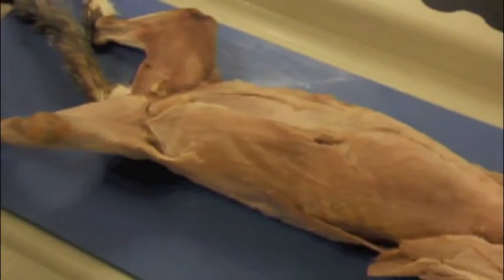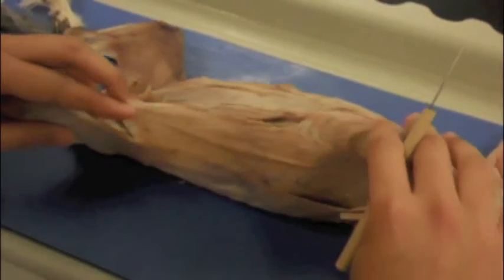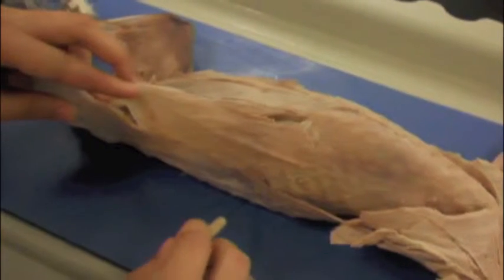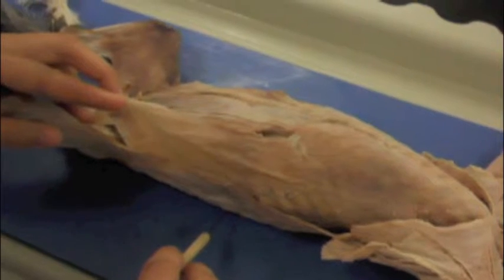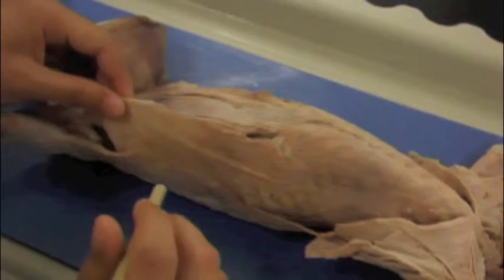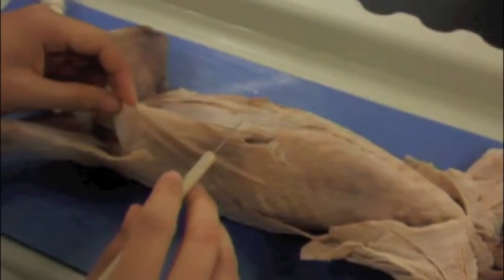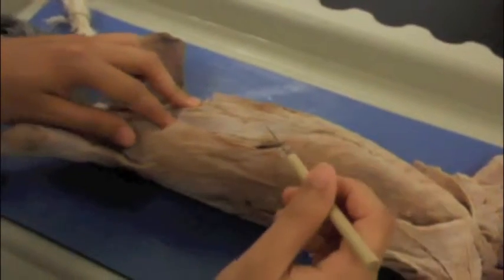Right, first we have the external oblique, which originates from the posterior ribs and the lumbodorsal fascia, which is an aponeurosis. An aponeurosis is a muscle-to-muscle connective tissue, and for the external oblique, it extends and runs towards the stomach of the cat and inserts into the linea alba, which is this white line of muscle, which is also aponeurosis.